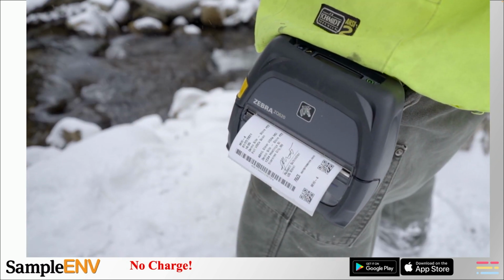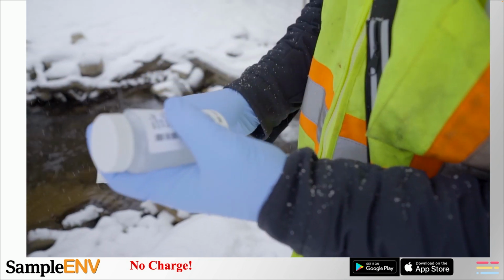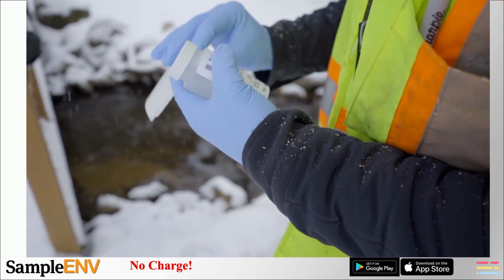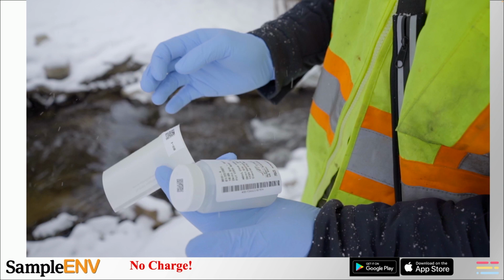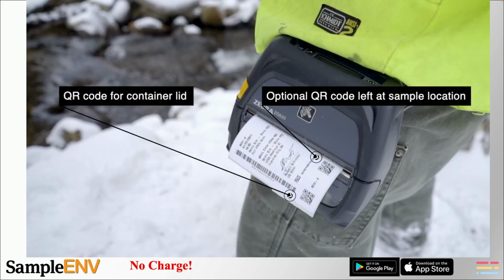As you can see, our labels are unique in that they are printed in the field and they are legible. Our unique 3-part label has a main part with 2 separate QR codes. The main part has all the typical standard sample information. When you sign your name on the device, it's going to be printed above your name on every label for that sample. It knows it's you because you've logged in under your unique username and password.